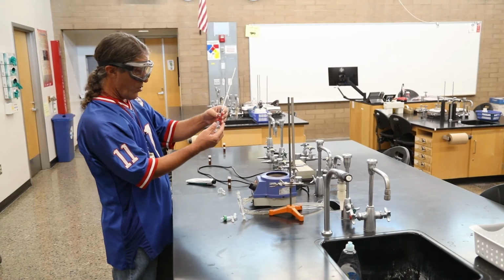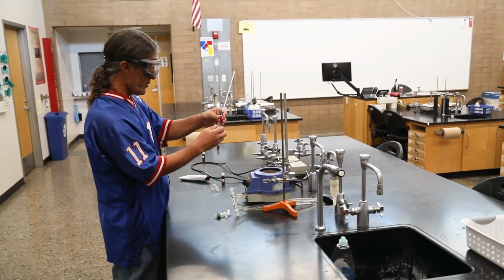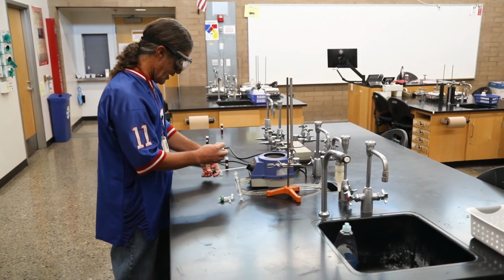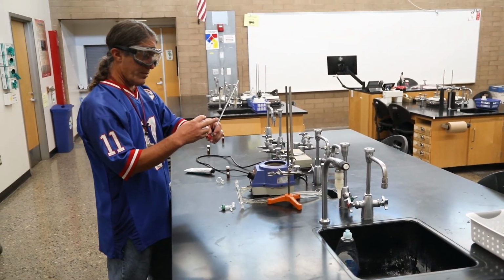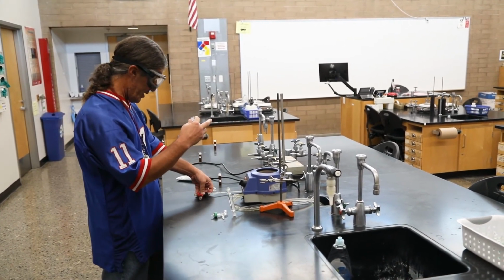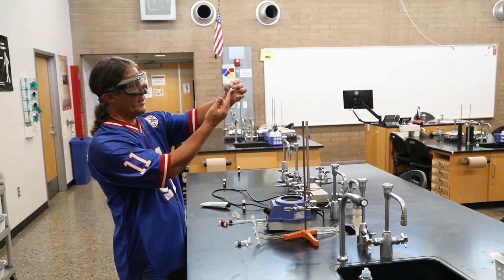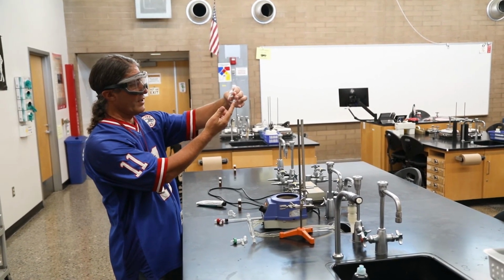This is still pretty warm. Again, the glass stays warm for quite a while, especially in Arizona. I'm disassembling this guy. Be very careful with the thermometer. A little bit of pressure on here could break it, so I lay it down carefully. Make sure nothing gets put on top of this, because that'll snap it like a twig, because it is very much like a twig. And we successfully did not distill to dryness. We have a little bit of liquid here.